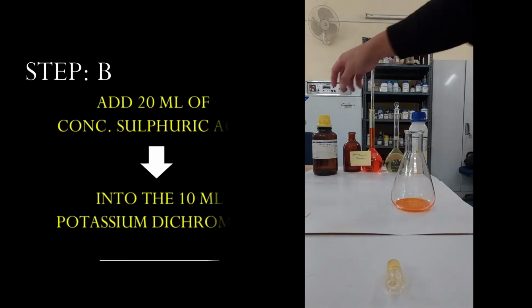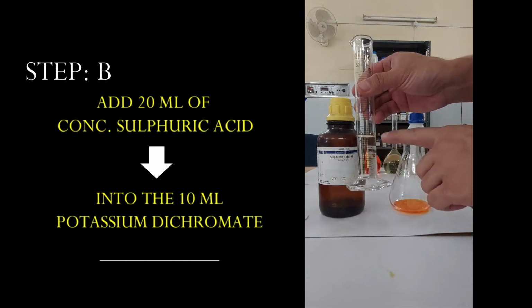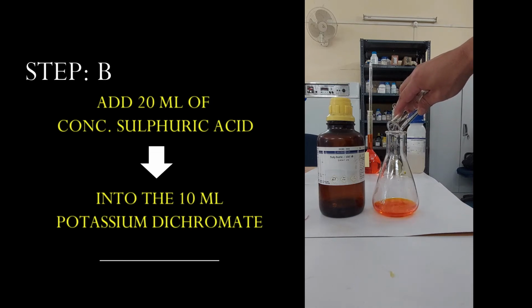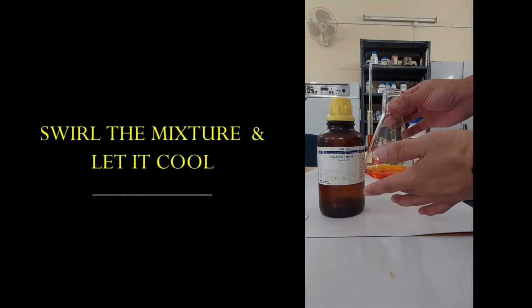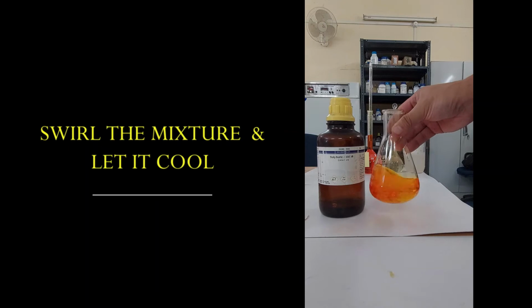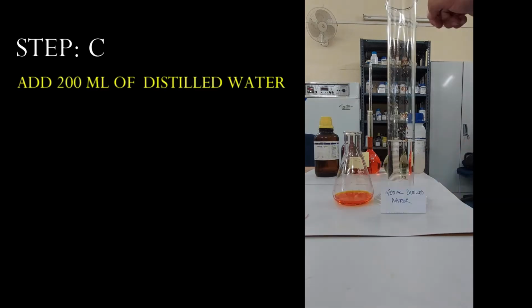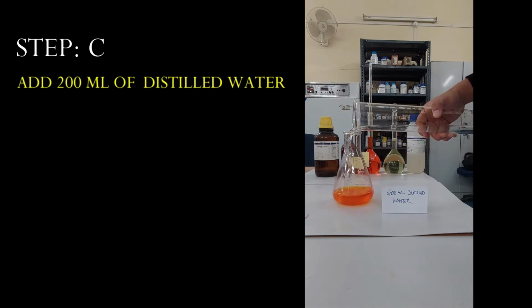Then to it, add 20 ml of concentrated sulfuric acid, swirl the mixture and let it cool for some time. After cooling, next add 200 ml of distilled water into it.